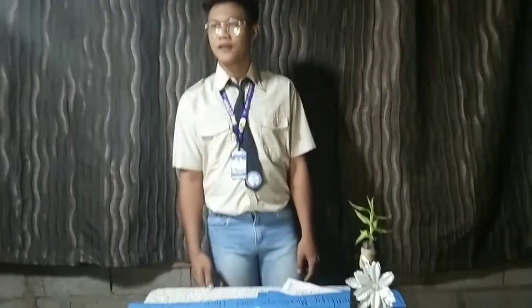So, who among you here can give a recap about our topic last meeting? You, ma'am? Okay. Our topic last meeting is all about the microscope. What is a microscope? A microscope is an instrument used to see objects that are too small to be seen by our naked eye.